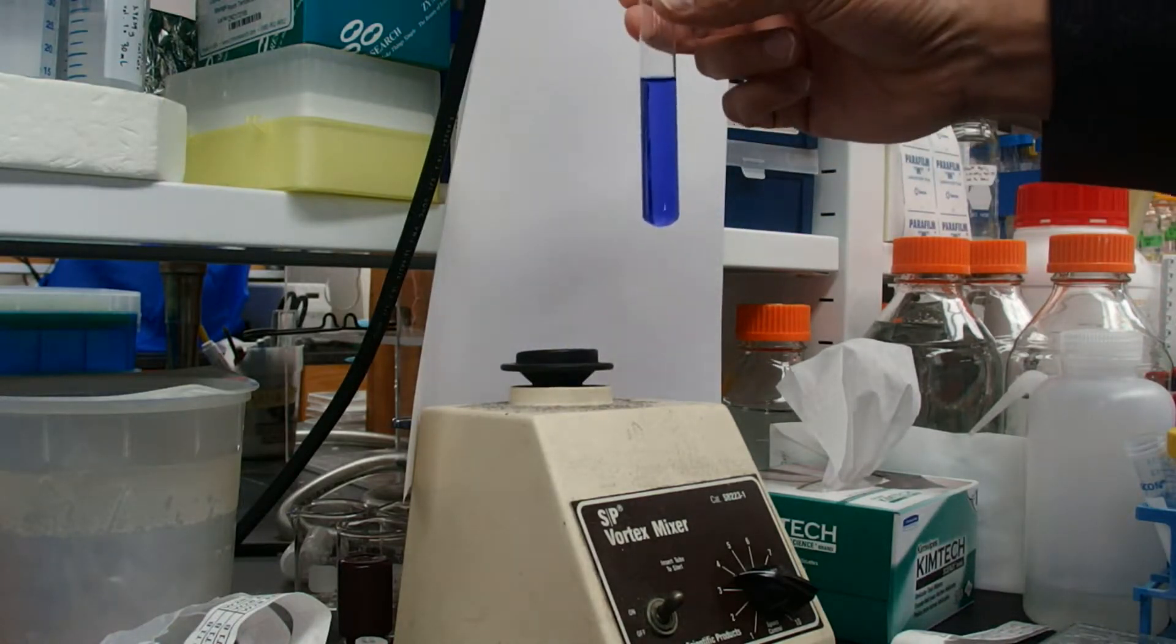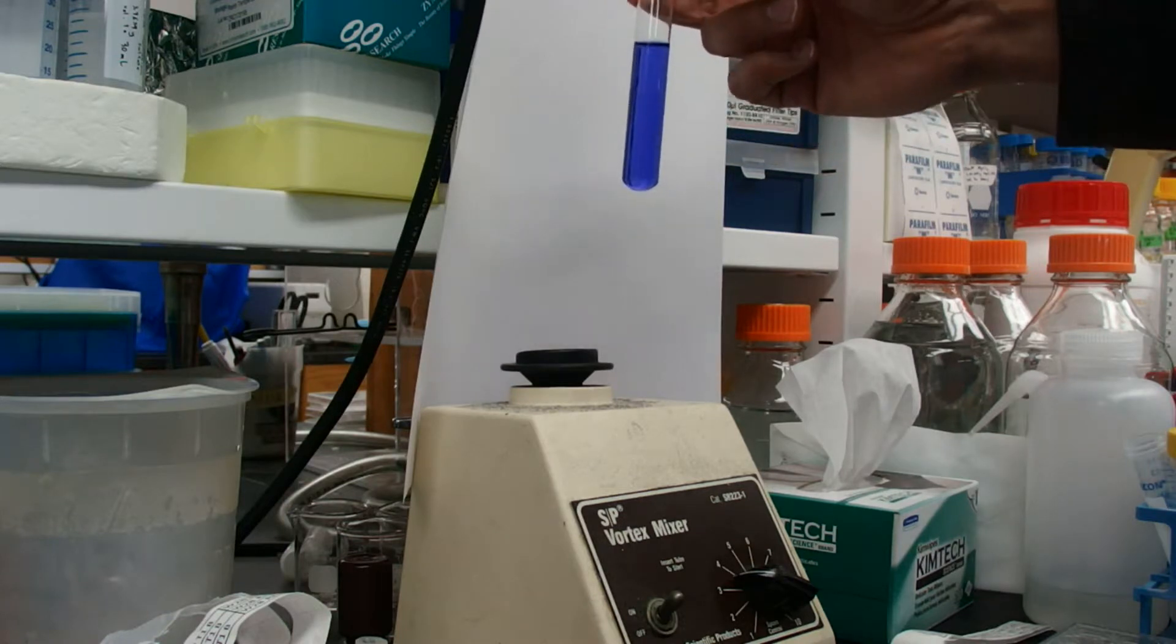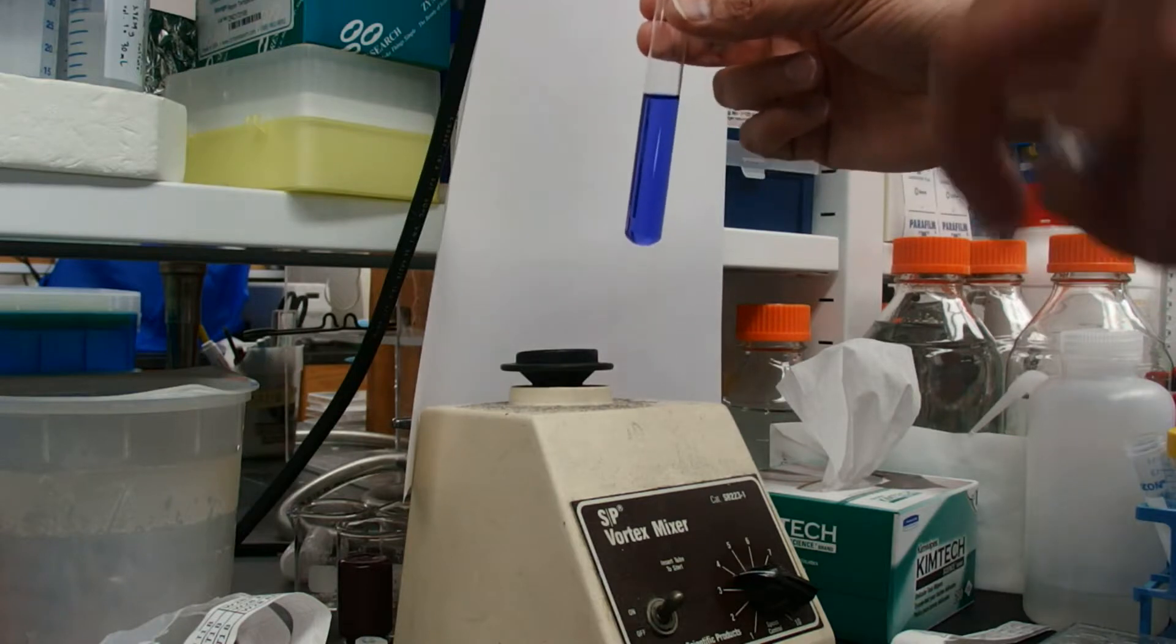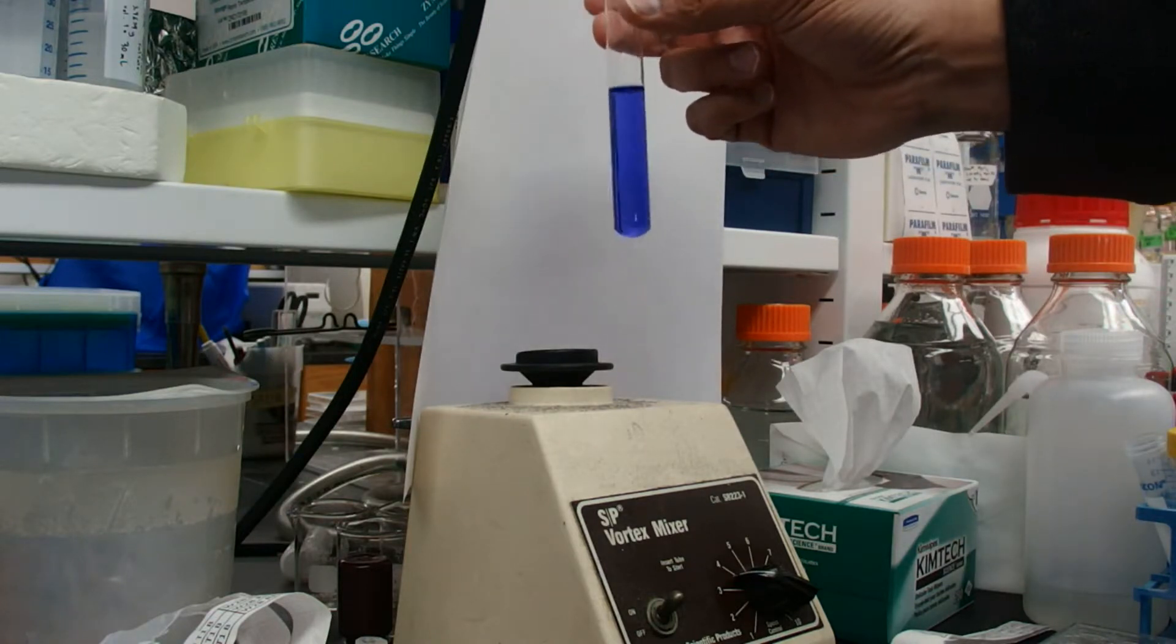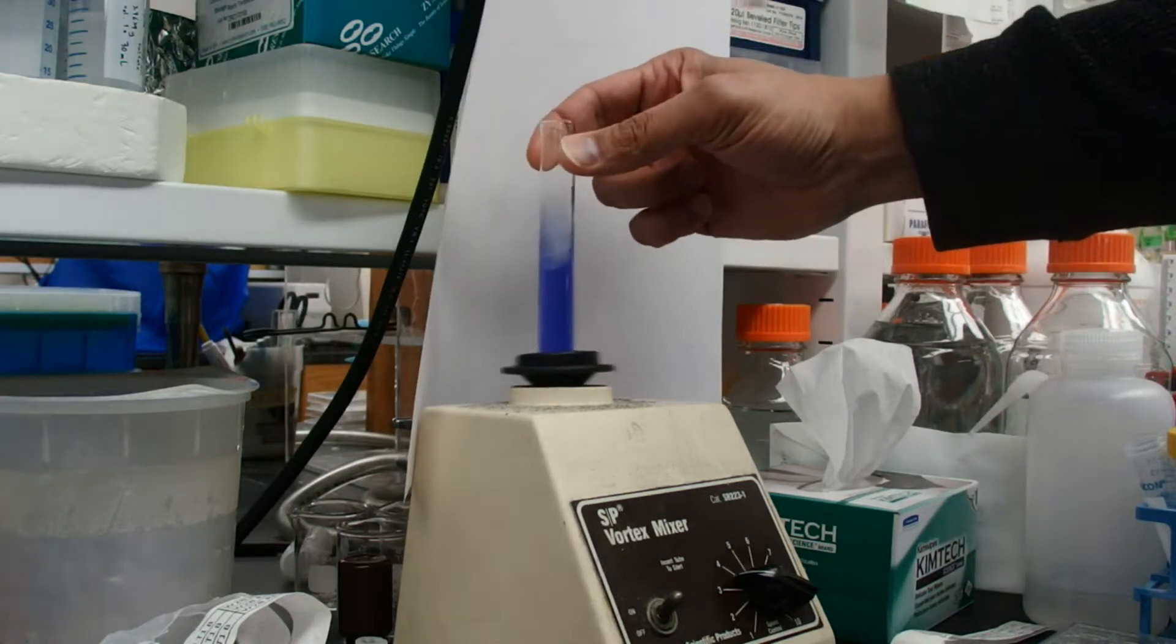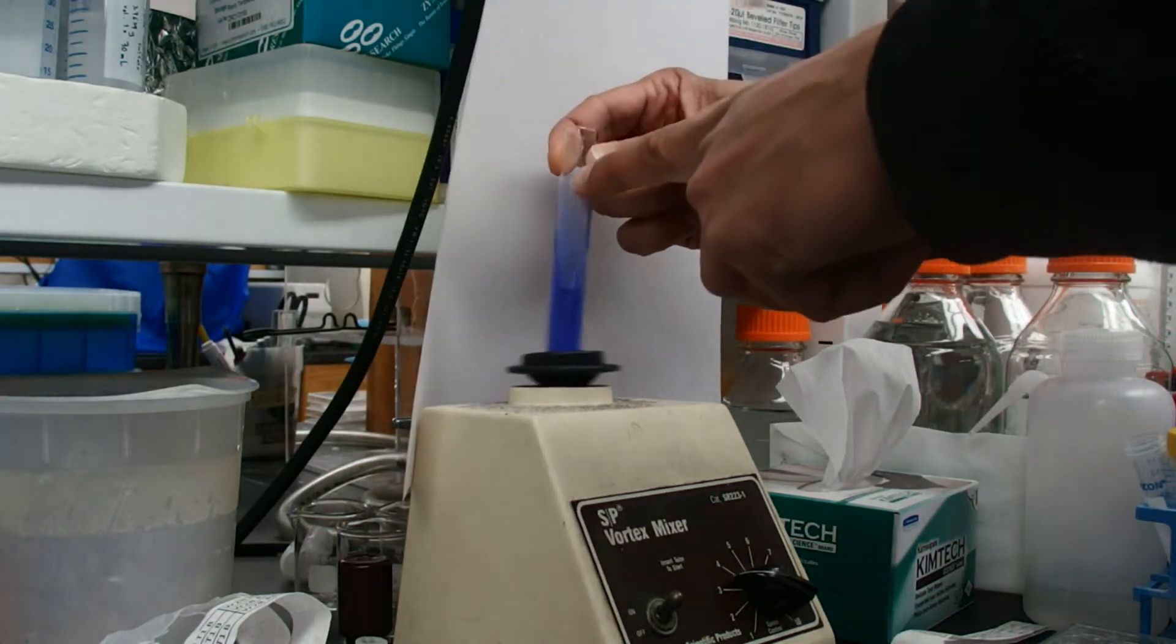Now you might be worried about vortexing too hard. The general rule is don't set your vortexer on a very high speed. You can always dial up as needed. And another rule is that typically the swirl doesn't move past where your fingers are.